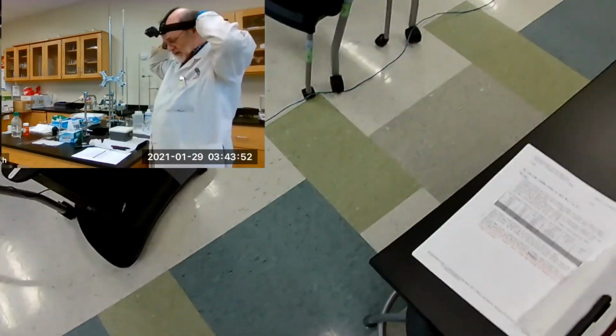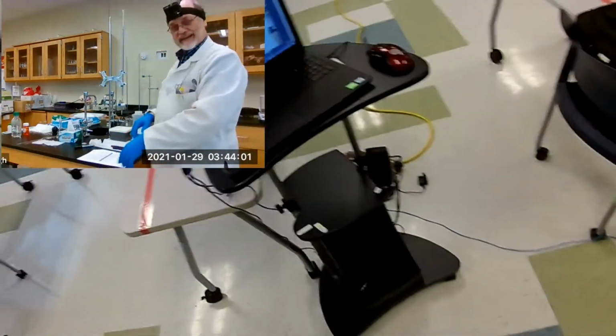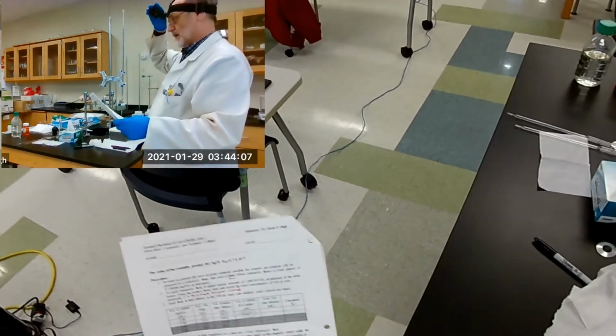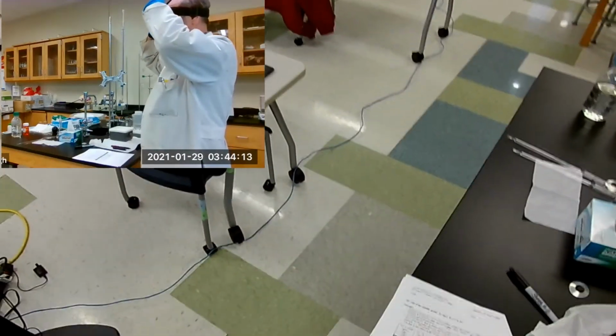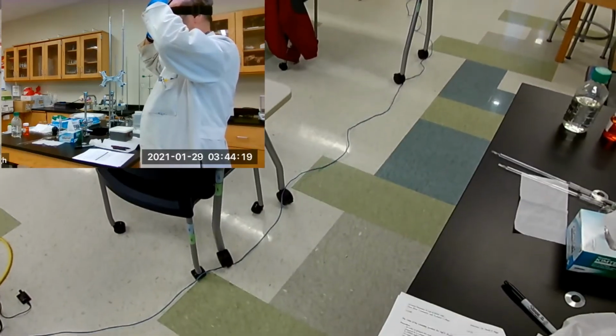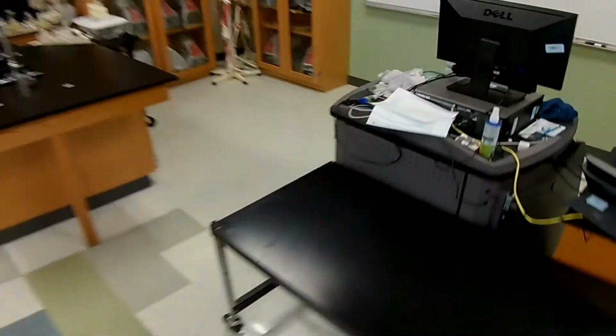Okay, so this is a good break point. We've finished the actual lab effort, and now we're going to go to how to treat the data. All right, so I'm going to tilt this camera up just a hair. Not too much. So we'll see the board a little better. All right, so now we're on the mobile cam.